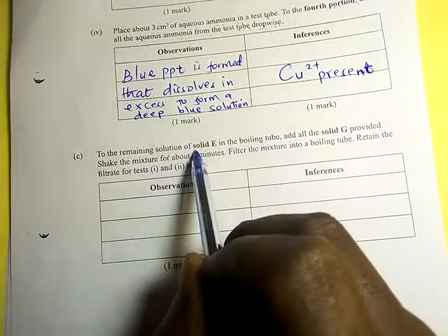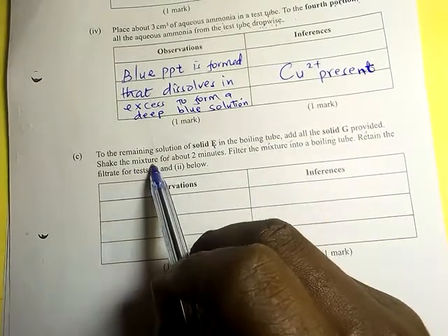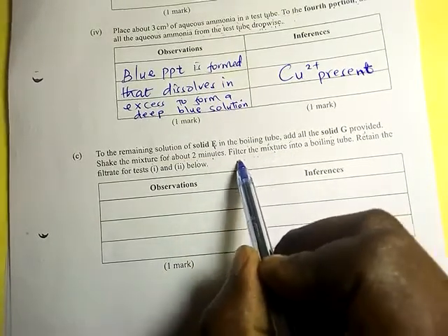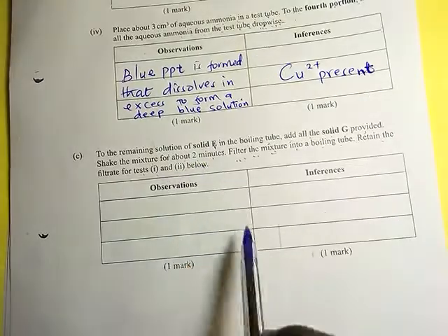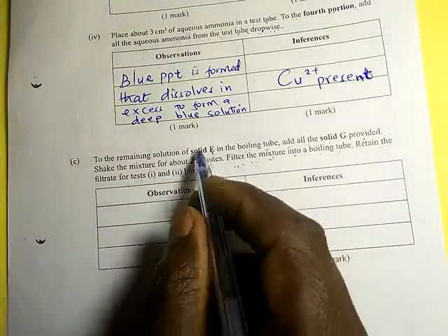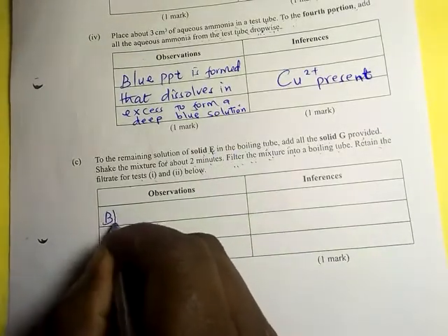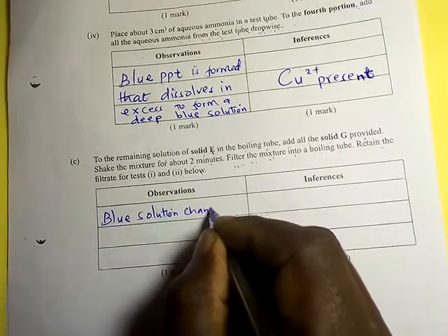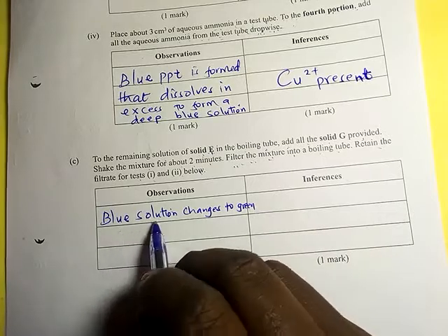To the remaining solution of solid E in the boiling tube, add all of solid G provided. Shake the mixture for about two minutes, then filter the mixture into a boiling tube. Retain the filtrate for tests Roman numeral one and two. The observation is that the blue solution changes to green.